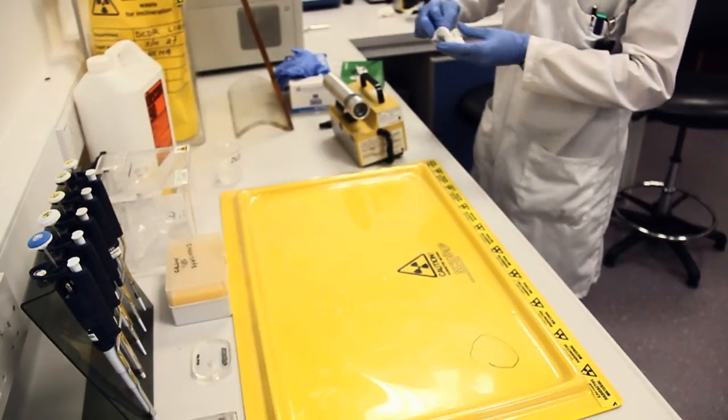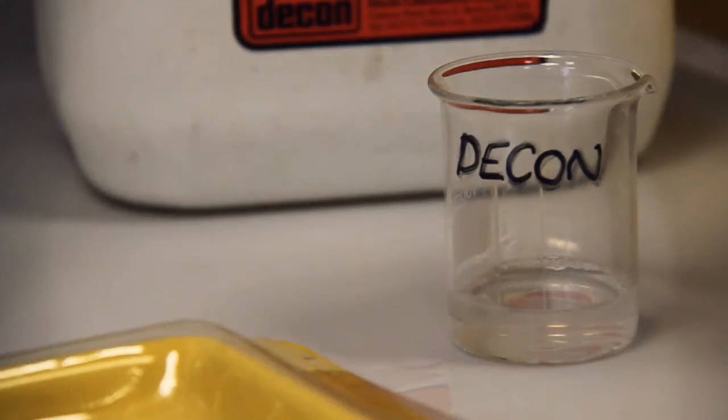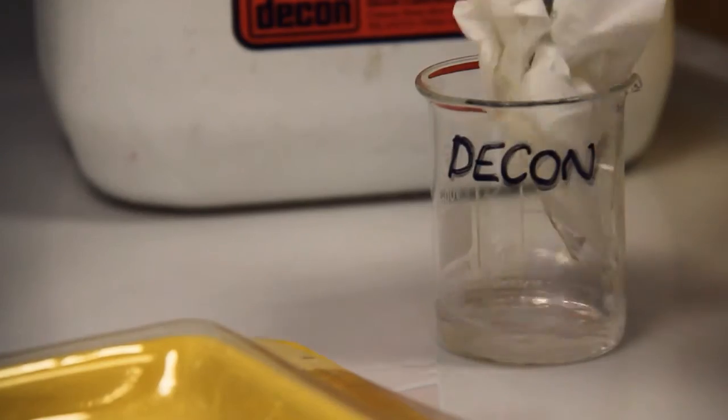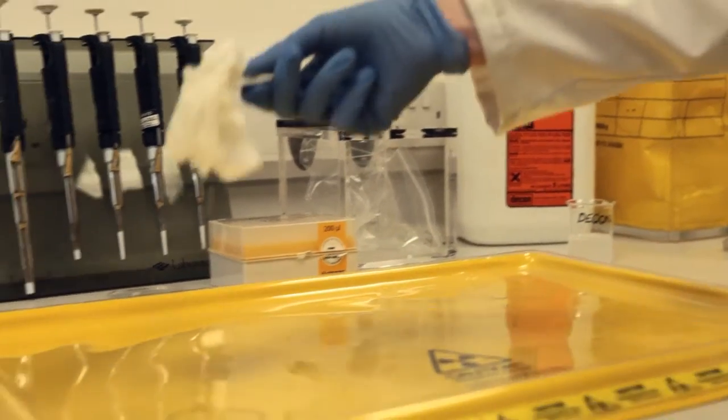Using tweezers, David dips a clean tissue into a beaker of decon before moving it over the contaminated area and wiping thoroughly.